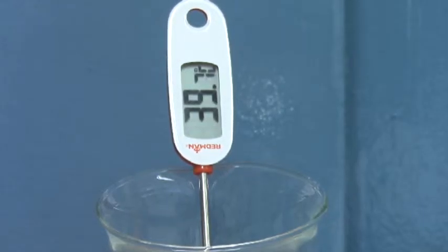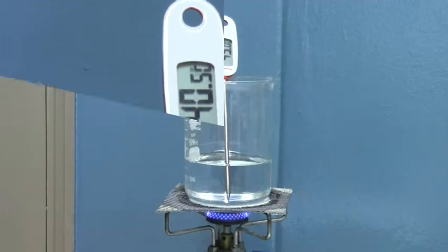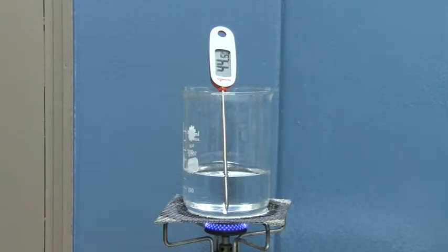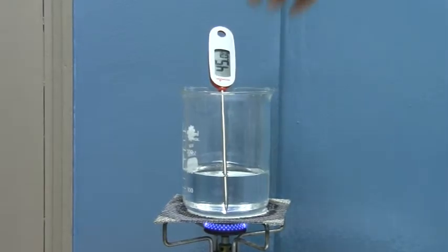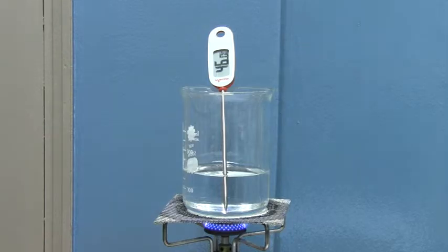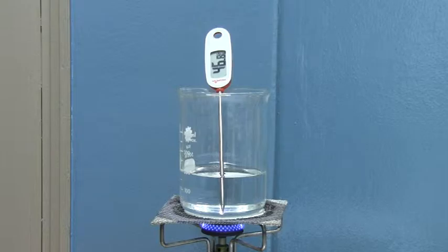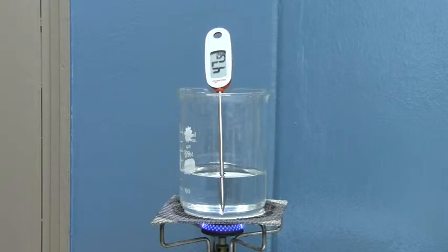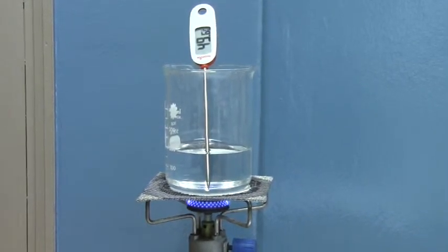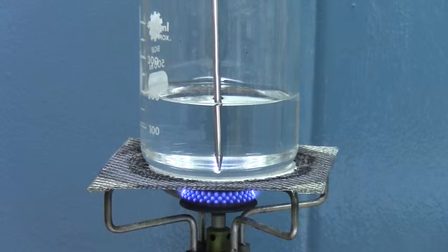Temperature is now 38 and increasing. Temperature is now 43 degrees Celsius, then 45, then 46. And now the temperature of the beaker is high enough so that the condensation that was forming on the outside of it has all evaporated away. You can see it looks clear now.